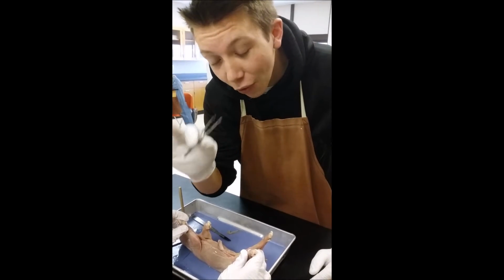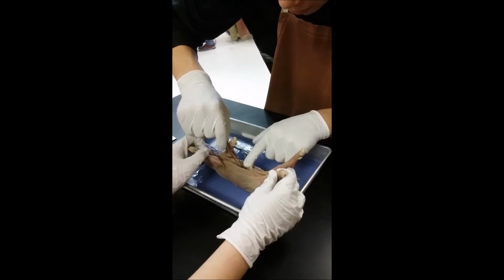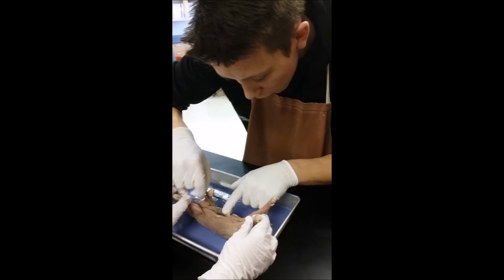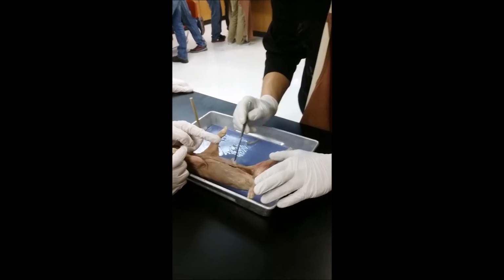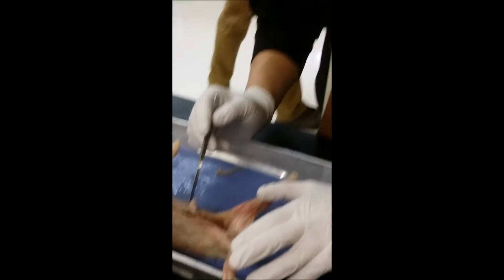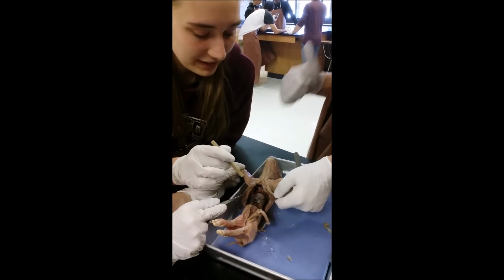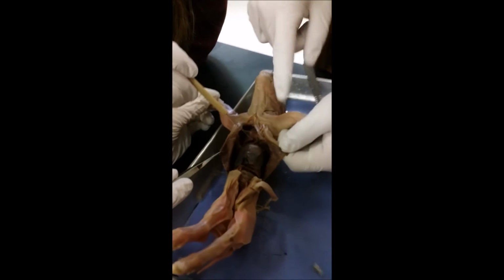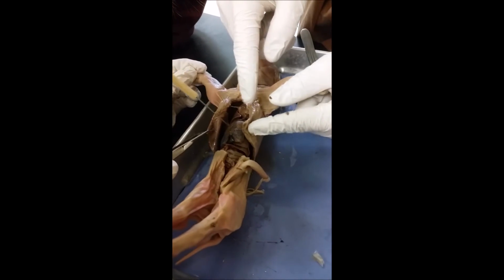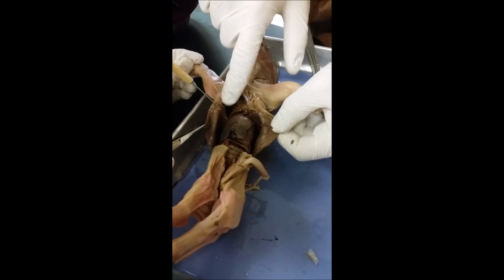Now I'm going to use the forceps and peel the lateral flaps open. See that? Just like that. There you go. Make an incision to expose the diaphragm in between the diaphragm and the ribs. After opening up more of these flaps, we exposed the diaphragm, which is right here. And this is where we made the cut. See that? And then we open this up wider. And these are the ribs, right here.